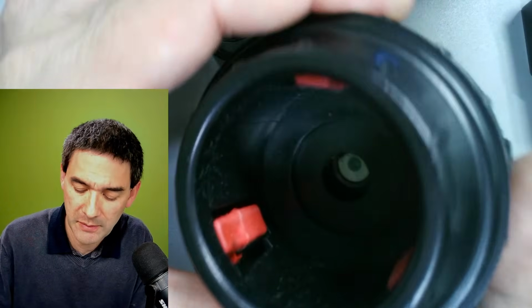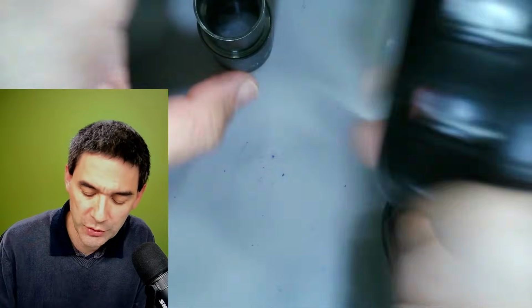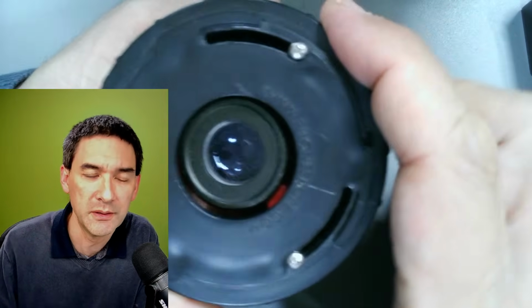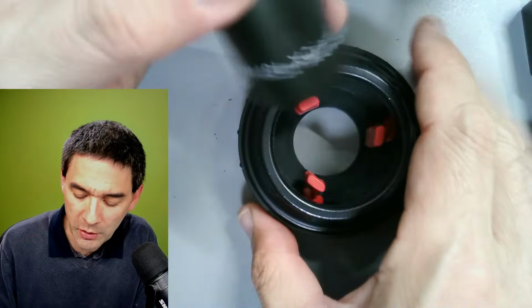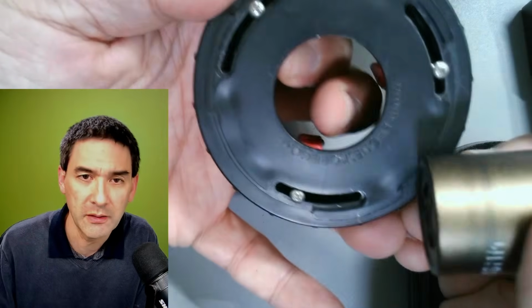Here we go again. You have to turn this here, and then it kind of closes, and then you have to tighten those screws here. Unfortunately, I also found out that I want to turn it a little bit more, but it's not possible because we're already at the maximum. So that's a little bit of a problem here. You can solve this issue by wrapping around a little bit more paper or cardboard to make the diameter wider, and then I think it should be okay.